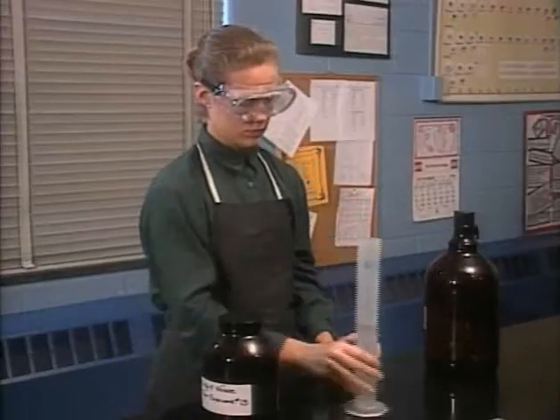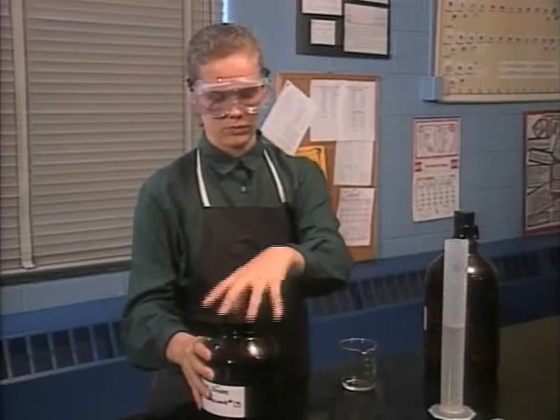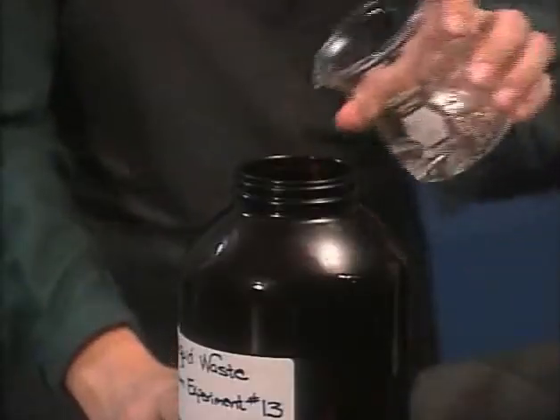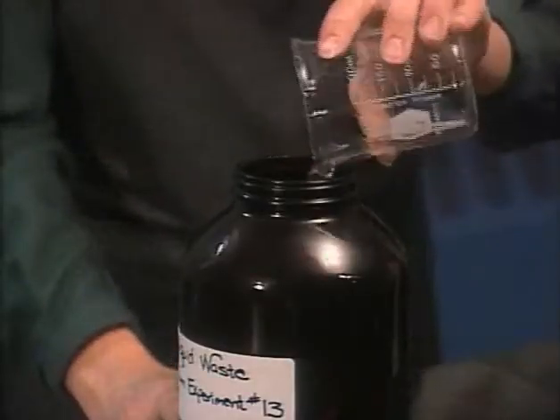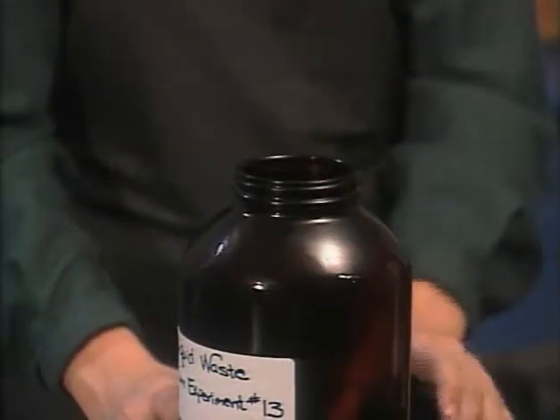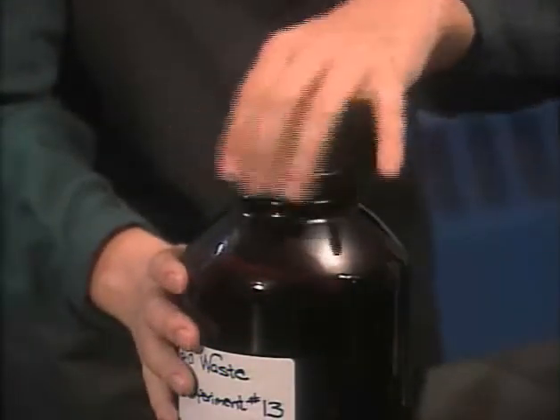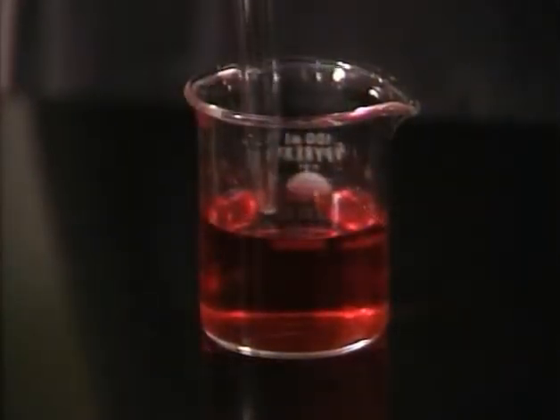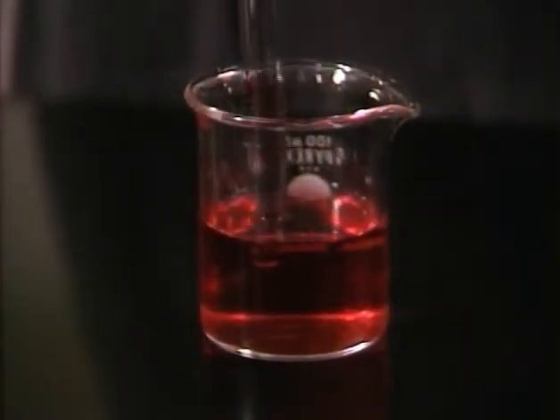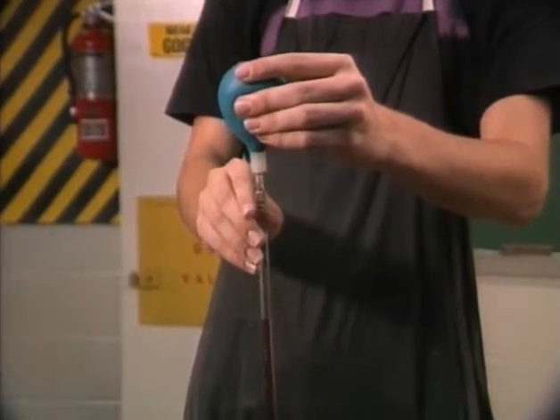After measuring out a reagent, you'll often have something left over. Instead of pouring it back into the reagent bottle, dispose of it in the proper waste container.